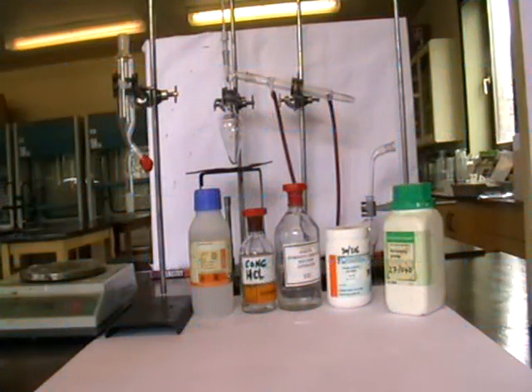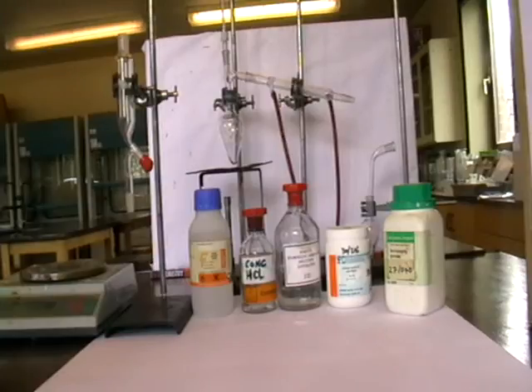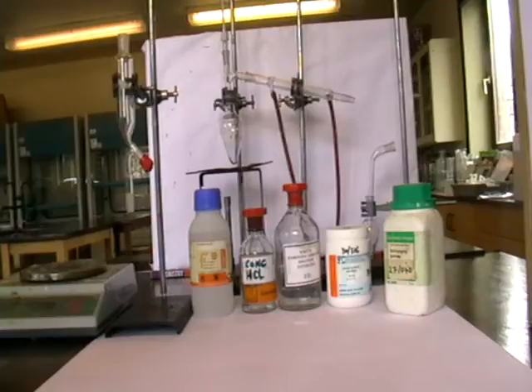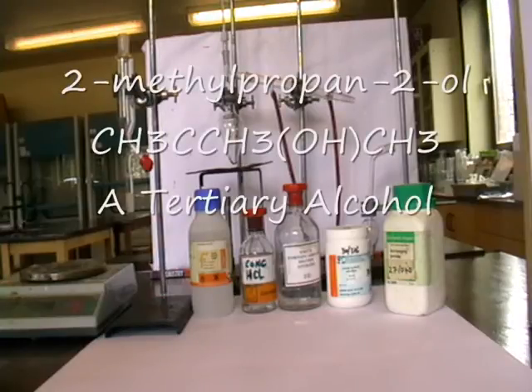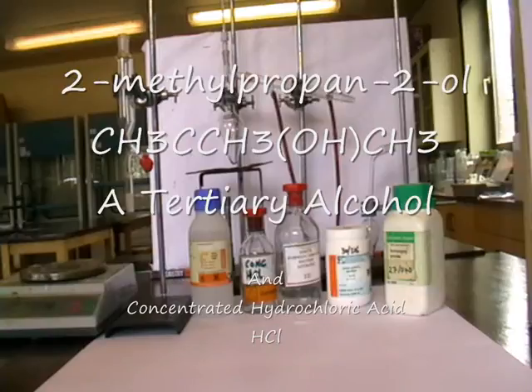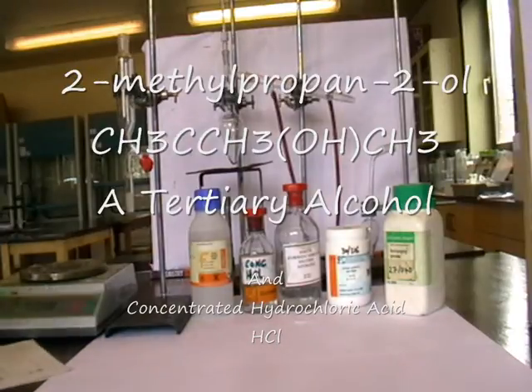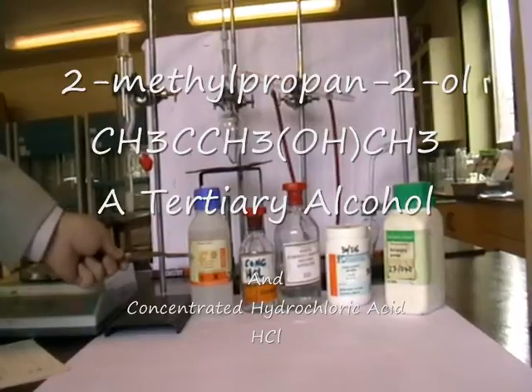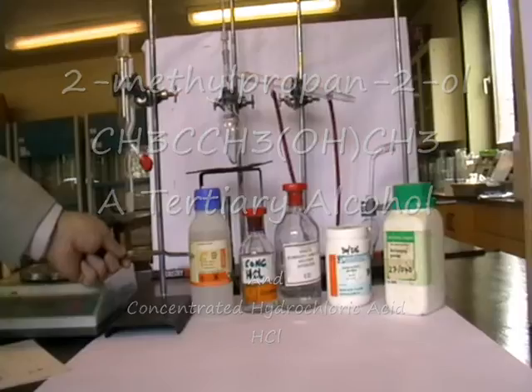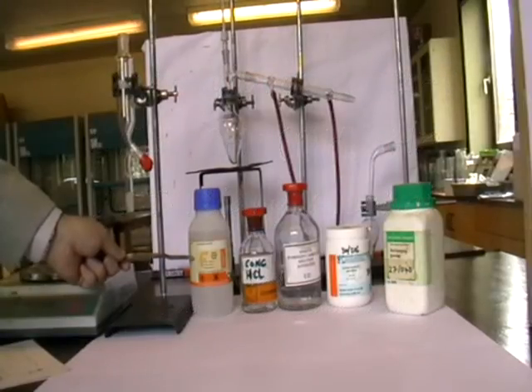We're using 2-methylpropan-2-ol, and we're going to introduce the halogen Cl — we're going to convert it to the corresponding chlorohalogenoalkane. Here you see the reactants that we need. We have the alcohol here, also known as tertiary butyl alcohol, or 2-methylpropan-2-ol.